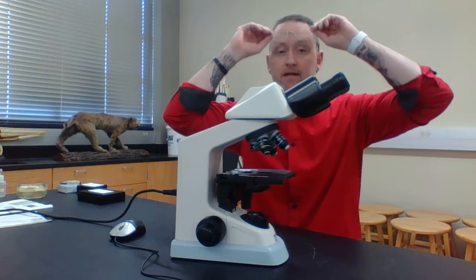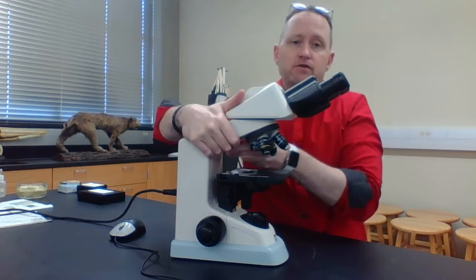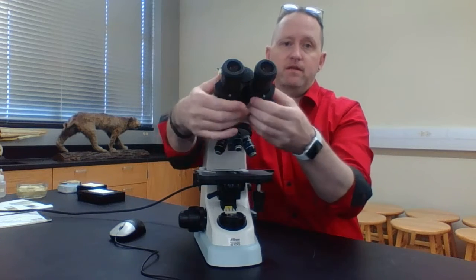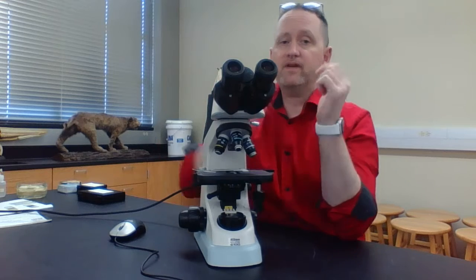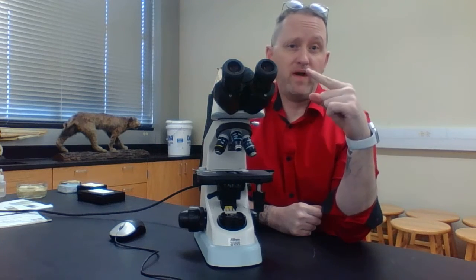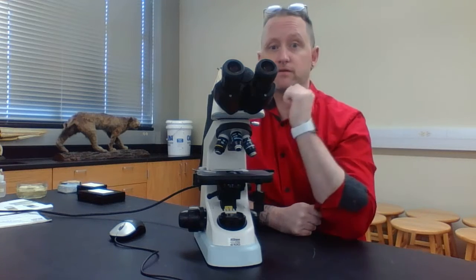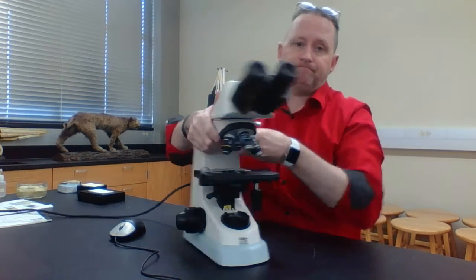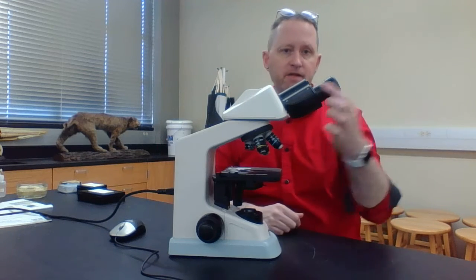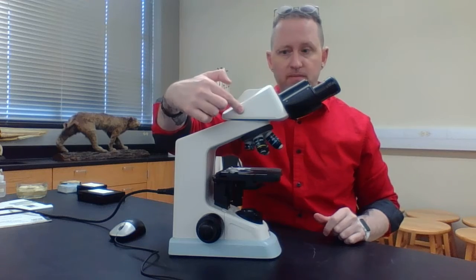And notice when you look at it, make sure your glasses are off. You can actually adjust this depending on the lengths of your eyes. And in one of these, there's actually going to be a pointer. So I can actually pull things out, look at that pointer and tell me what you are viewing or what you're seeing. And so again, eyepiece with the ocular lens. This is referred to as the body tube.